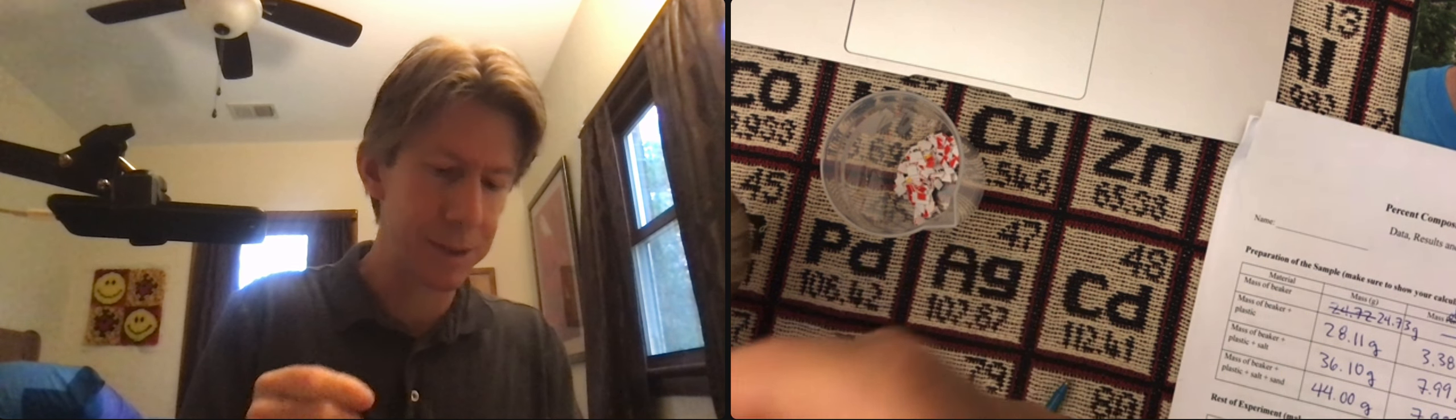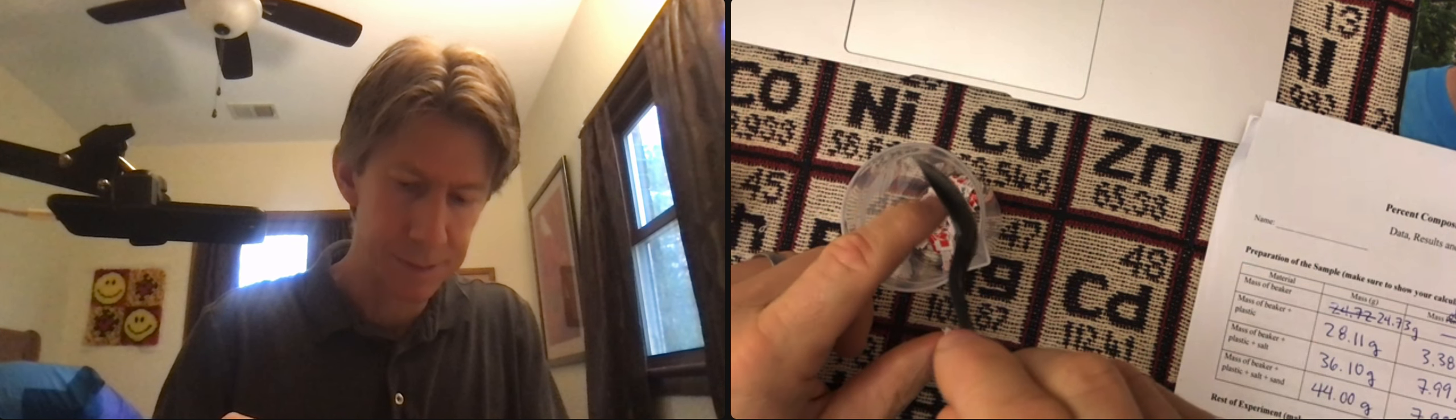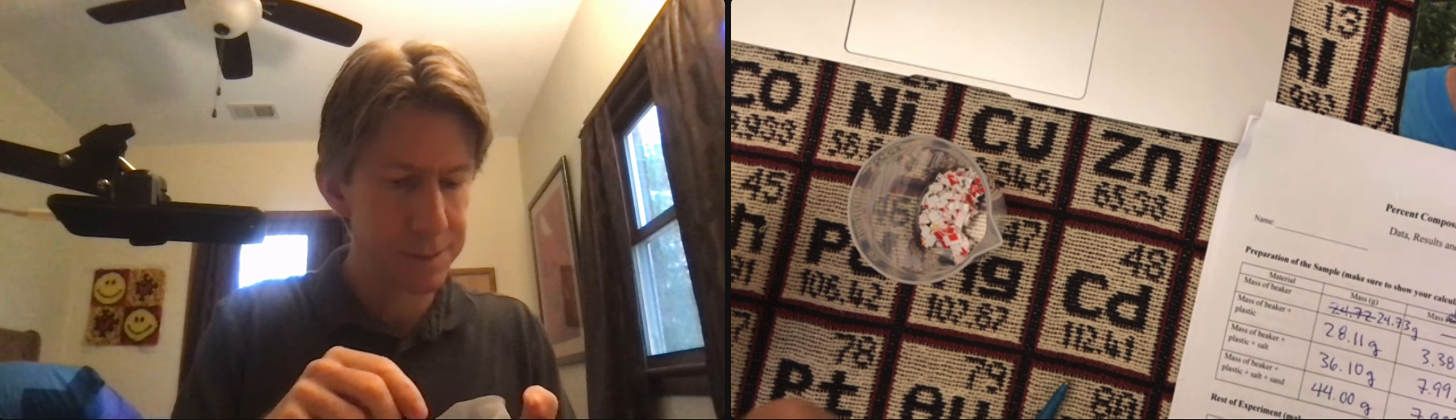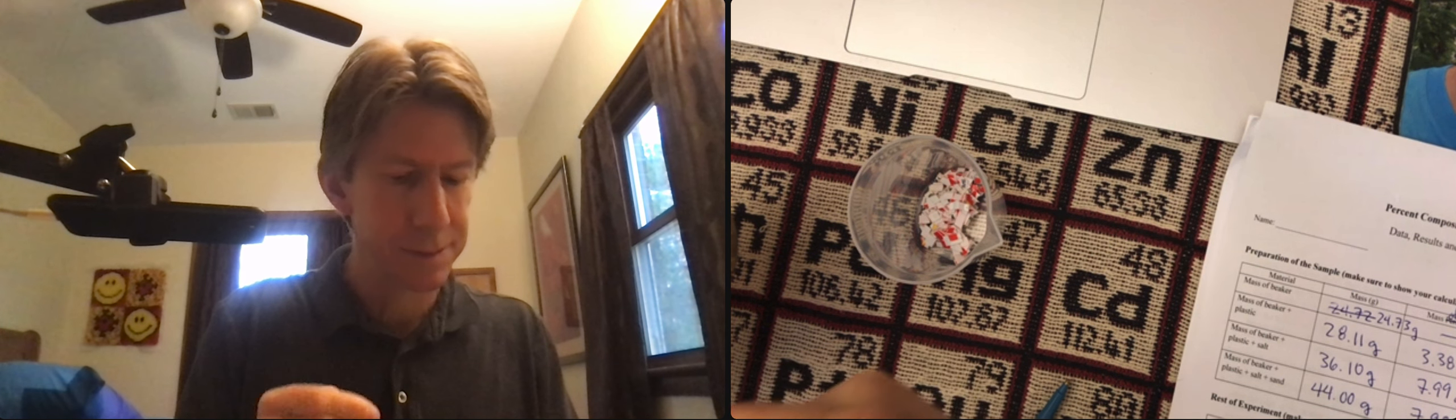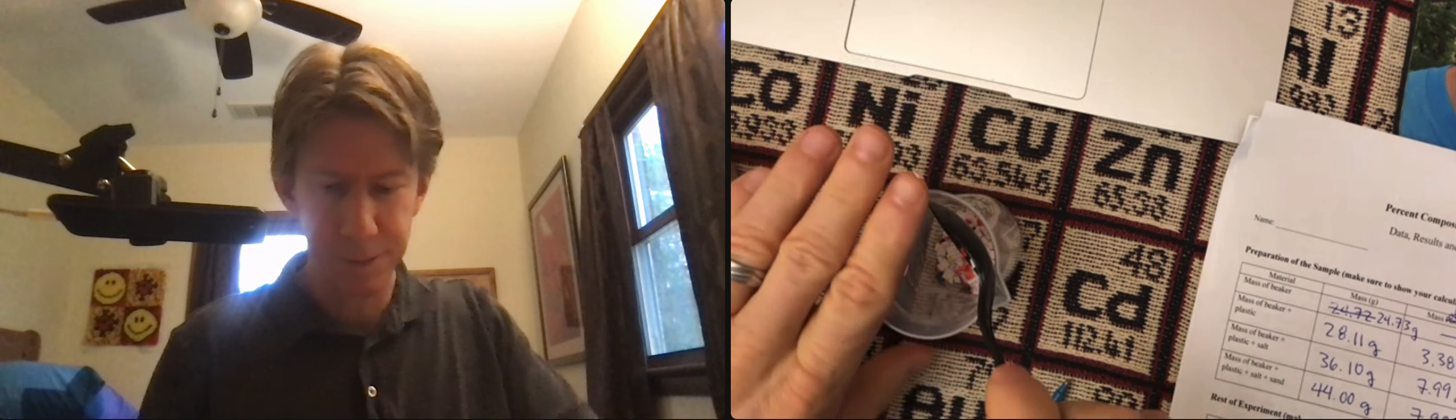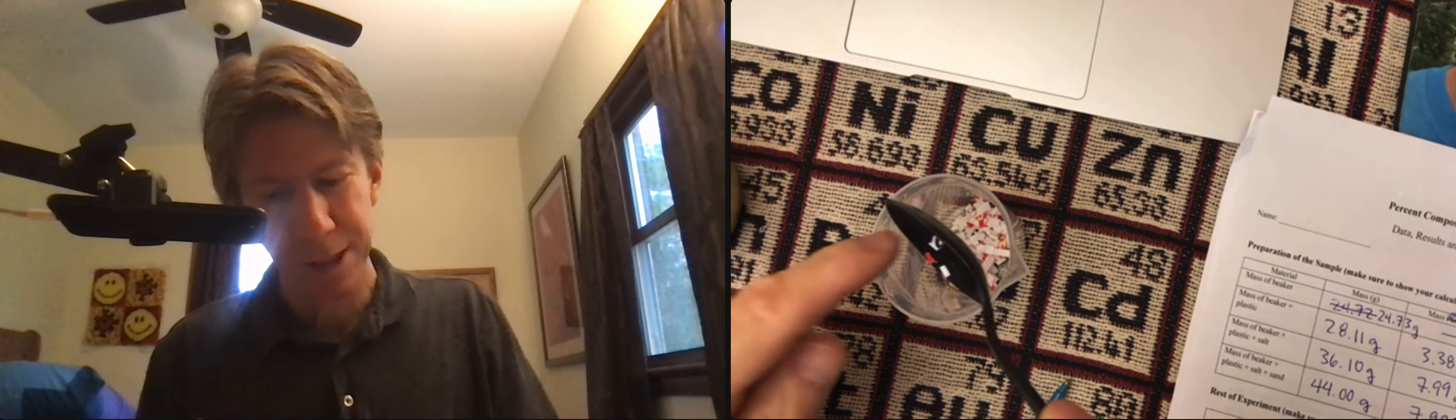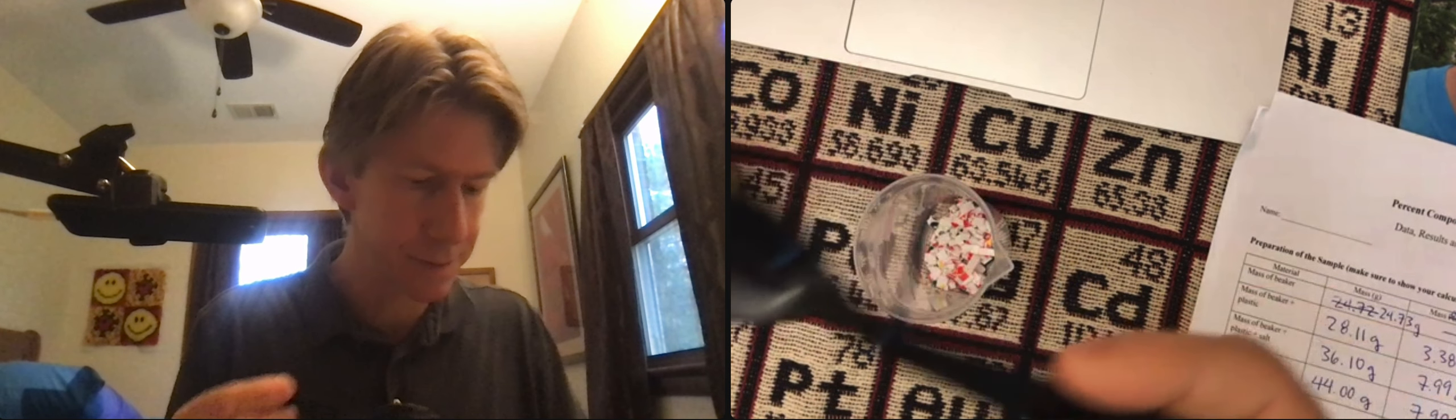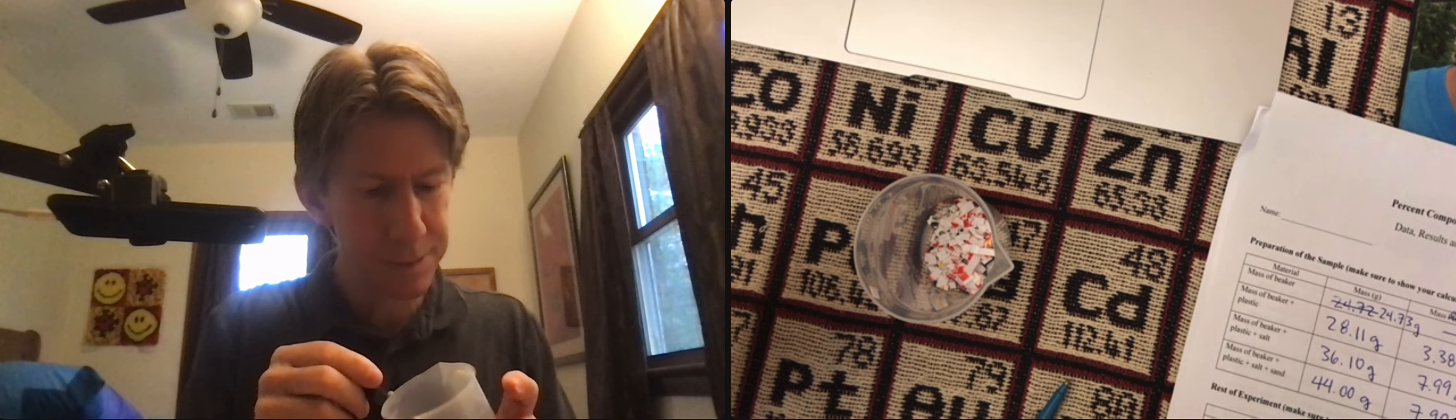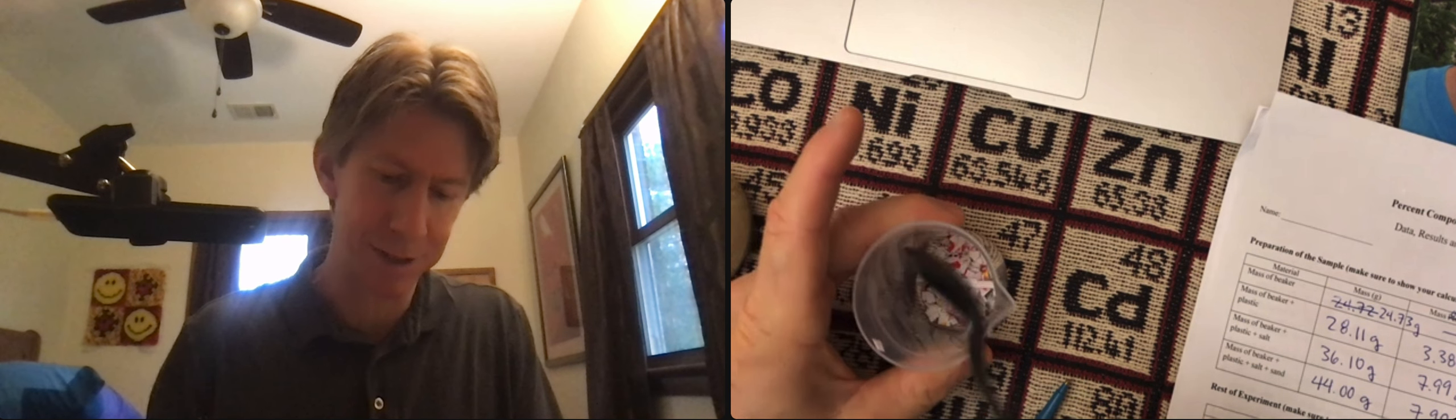This will take a couple minutes. Oh, got one stuck on my finger there. Why don't I stop the video while I do the rest of this? And while you do the rest of it.